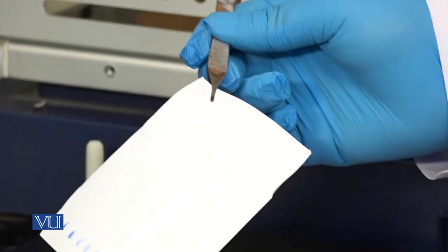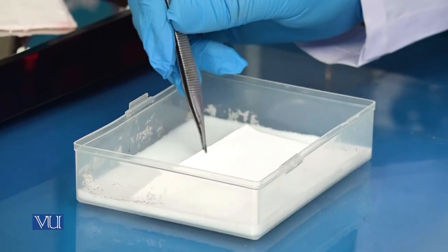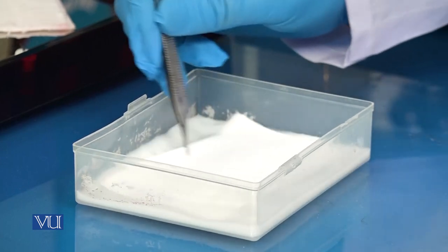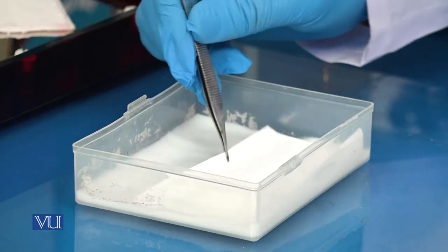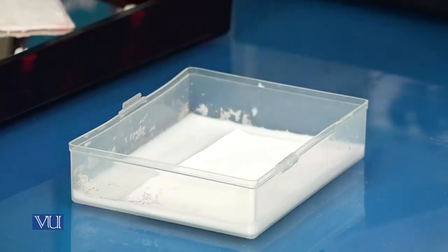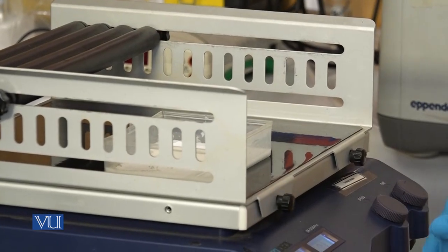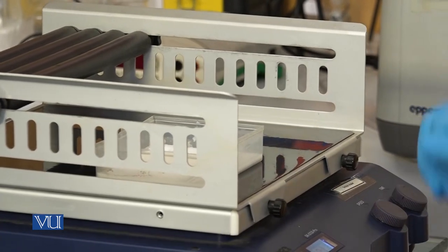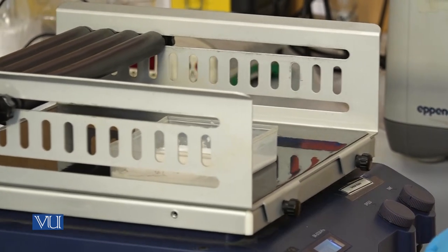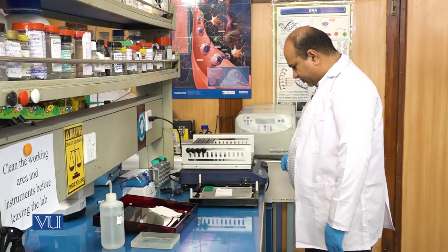Now let's put this membrane into milk. Milk here acts as a blocking agent; it is used for removing or inhibiting non-specific binding so that our target protein is distinctly identified. We will put the membrane in the milk and place it on a shaker for around one hour. Now one hour is complete, so let's stop it.